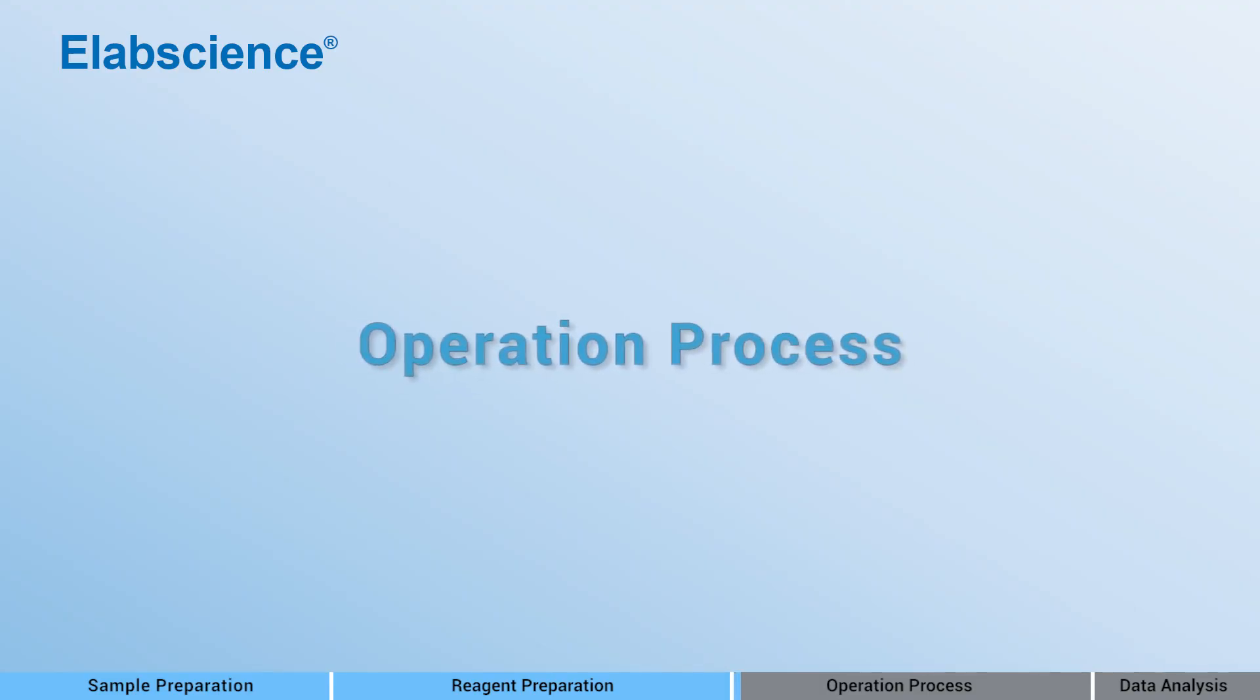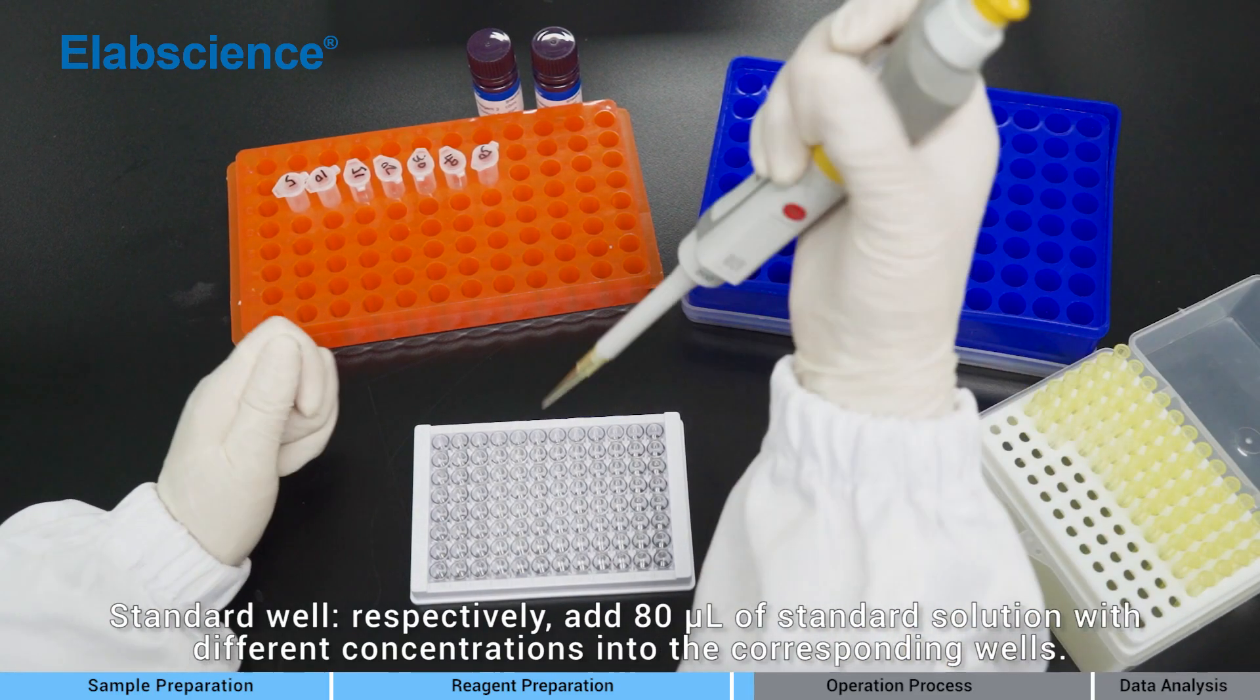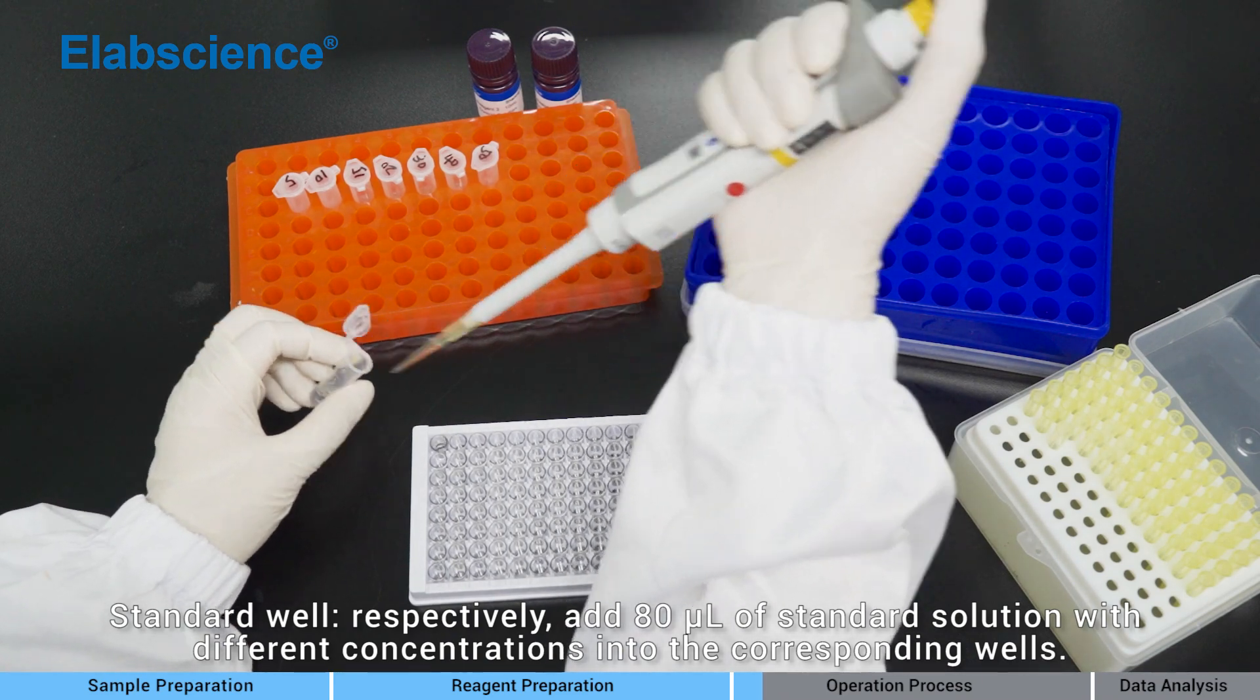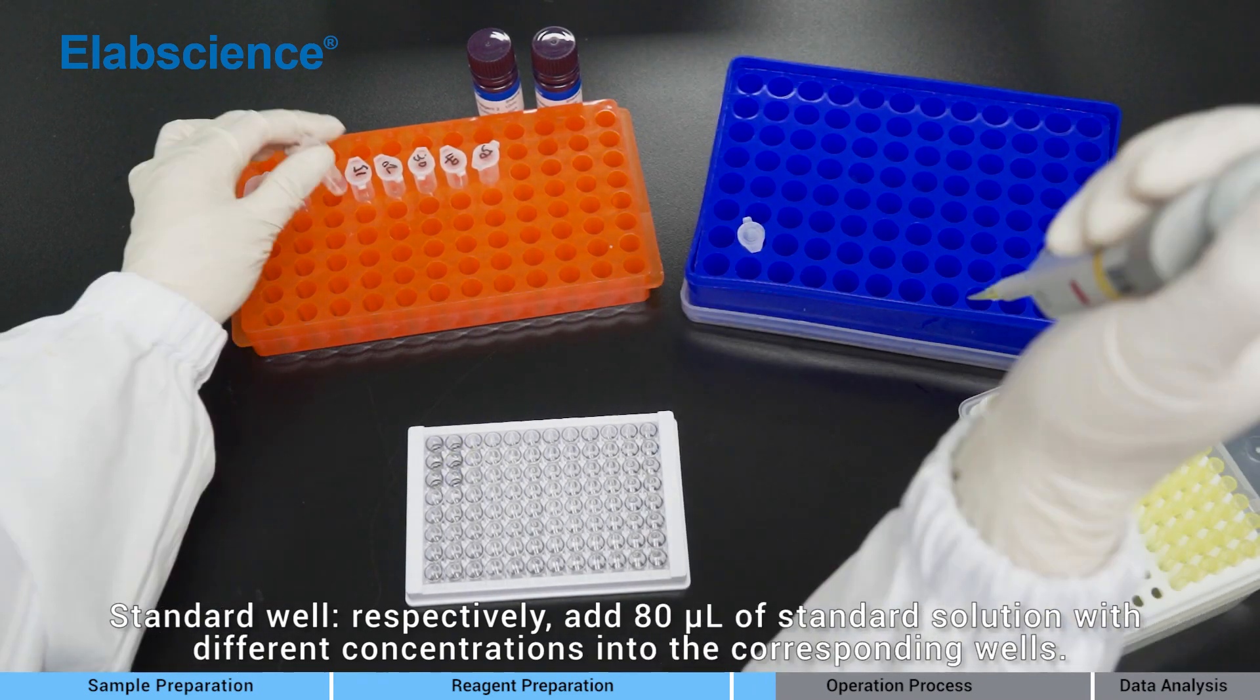Operation process: Standard well. Respectively, add 80 microliters of standard solution with different concentrations into the corresponding wells.